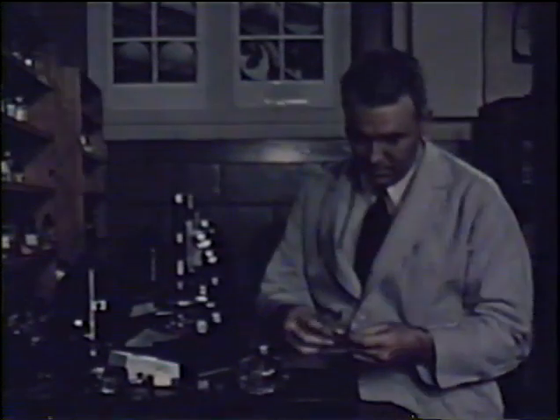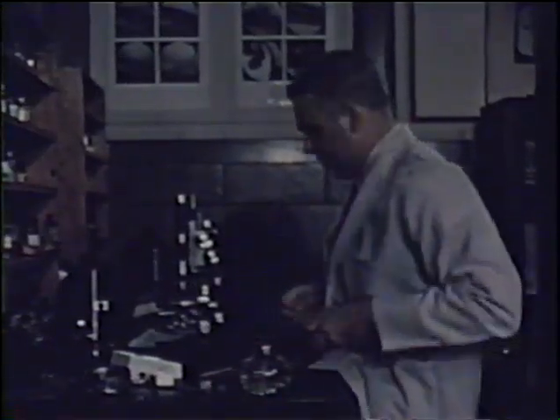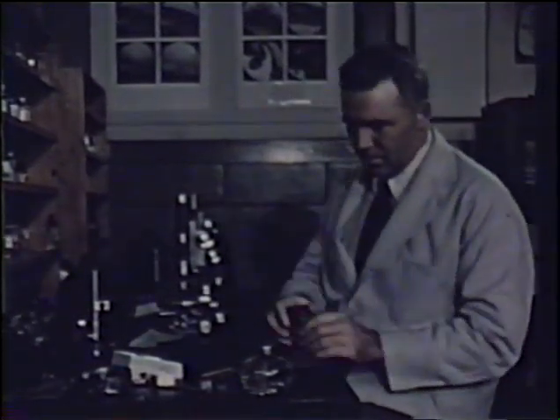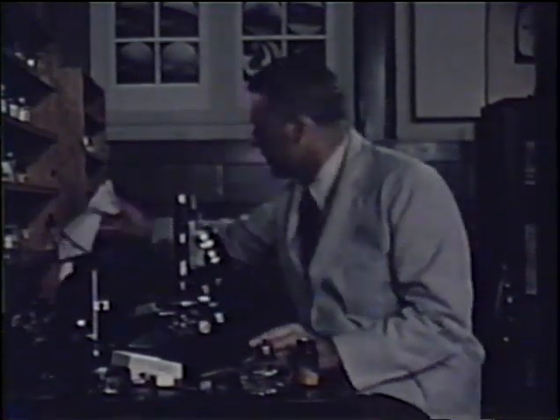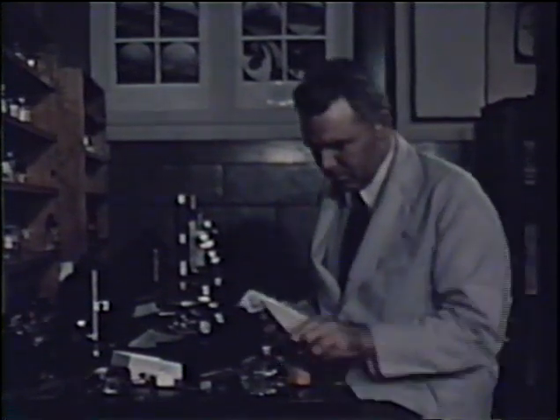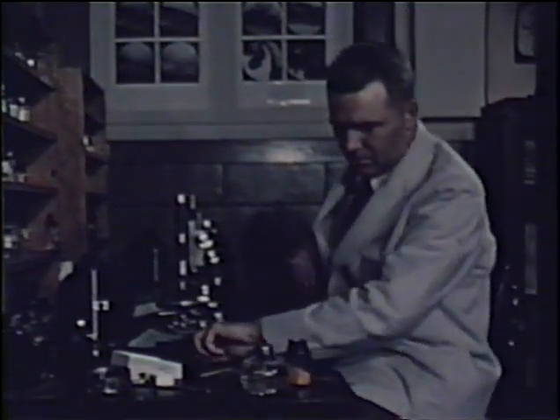The application of fusion methods includes all observations made during heating of a few milligrams of the substance on a microscope slide, during solidification of the melt, during cooling of the preparation, as well as observations on the crystallized material at room temperature. Fusion methods are perhaps most useful as a means of quick identification of an unknown, to determine whether two given substances are identical or whether a given sample is pure. They are also useful for the determination of composition diagrams and as a means of preparing good crystals for determination of the optical properties.